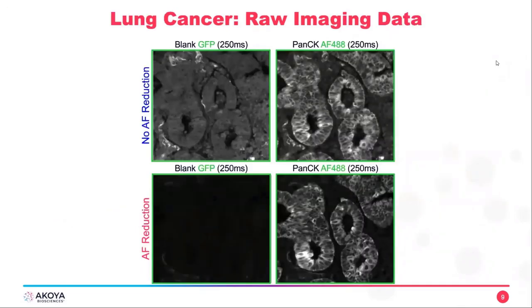Okay, so this is a highly autofluorescent lung cancer tissue. And I'd like to start by just talking about this autofluorescence again. So you can see in this top left panel that this is epithelia. There are actually no reporters or fluorescent dyes on this top left image. This is purely the innate autofluorescence and background of the tissue itself. And it's a beautiful tissue, but this background can be distracting from the actual signal from your marker expression.